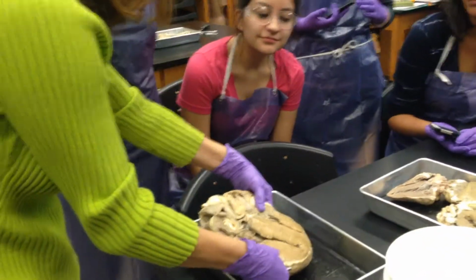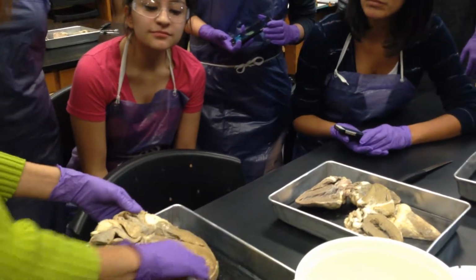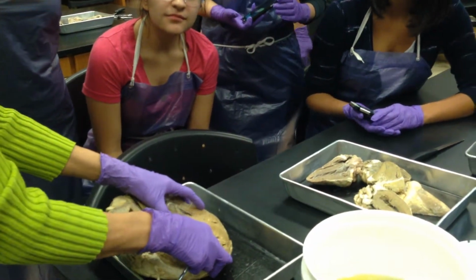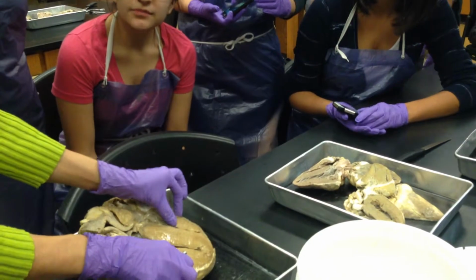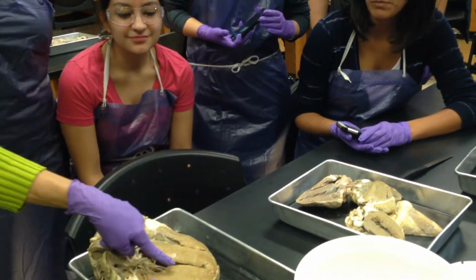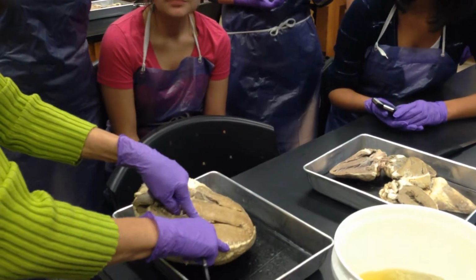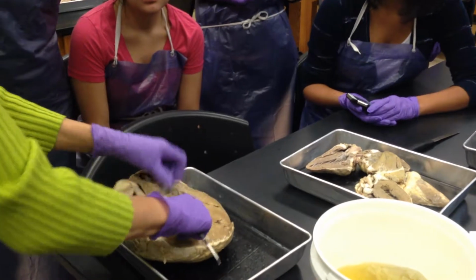Identify. Okay. We see the two sides. You see this side, you see this side on the bottom. Identify this chamber right here. Compare this to this. So this must be the left ventricle, because see how thick that outer edge is compared to this one? So if it has a thick outer edge, that means this is the left side of the heart.